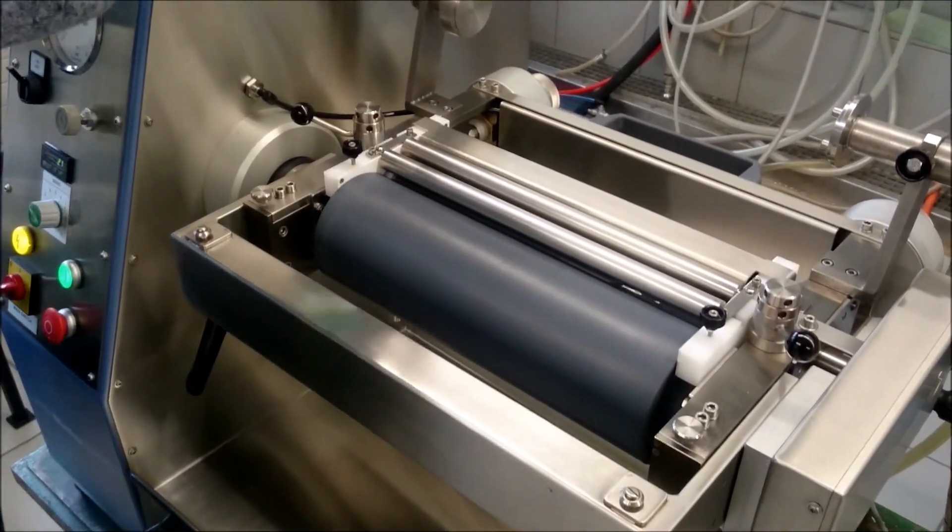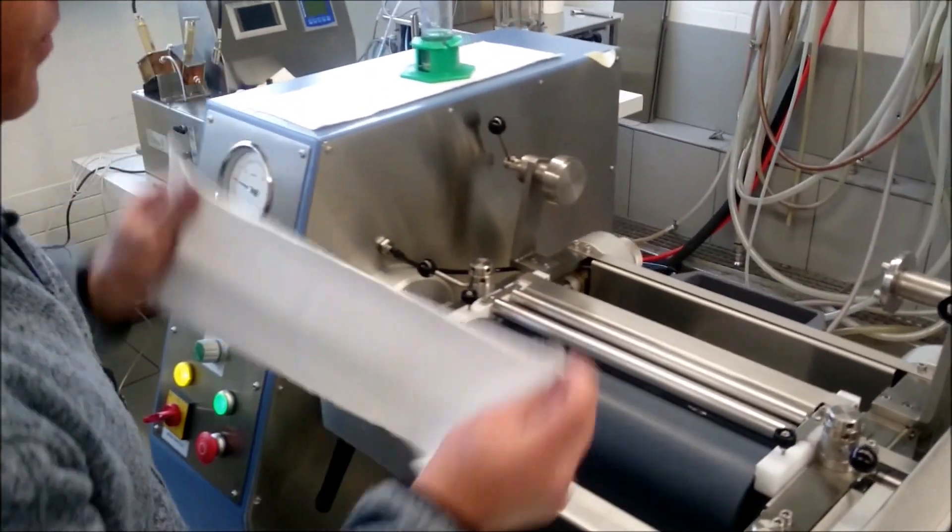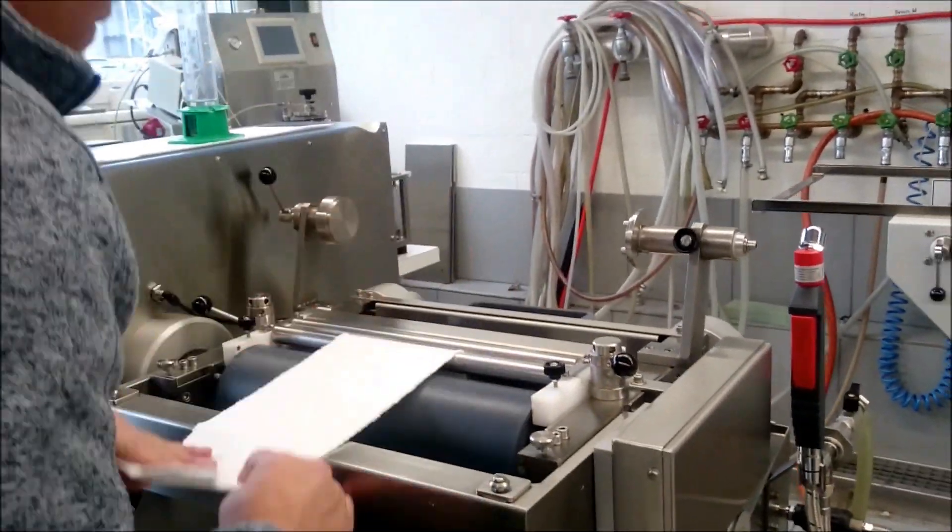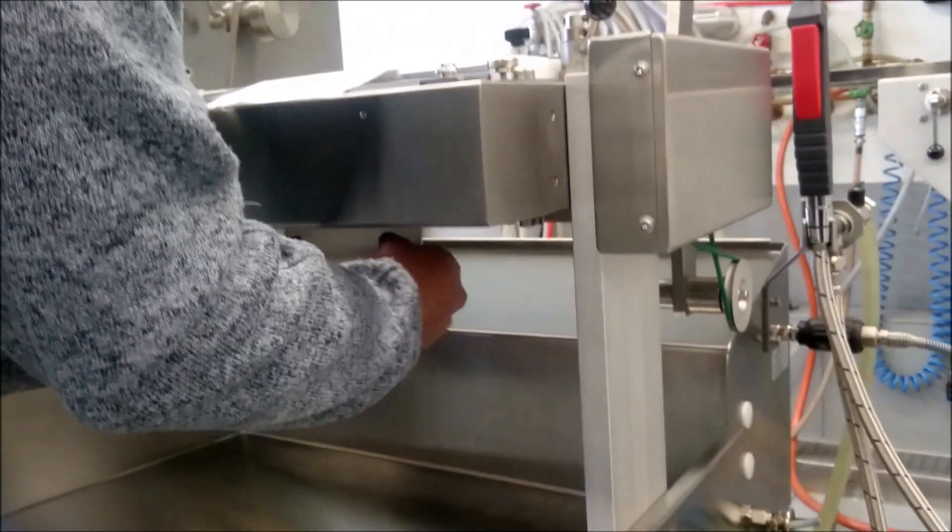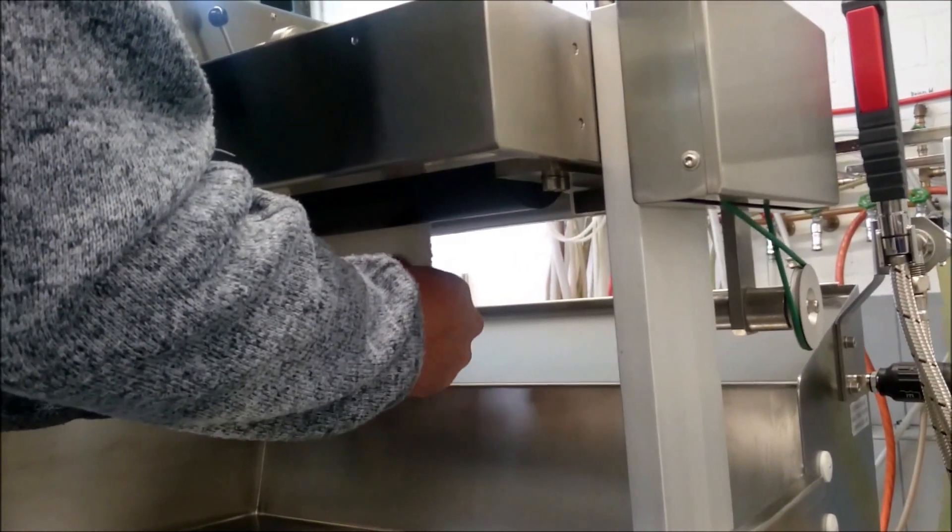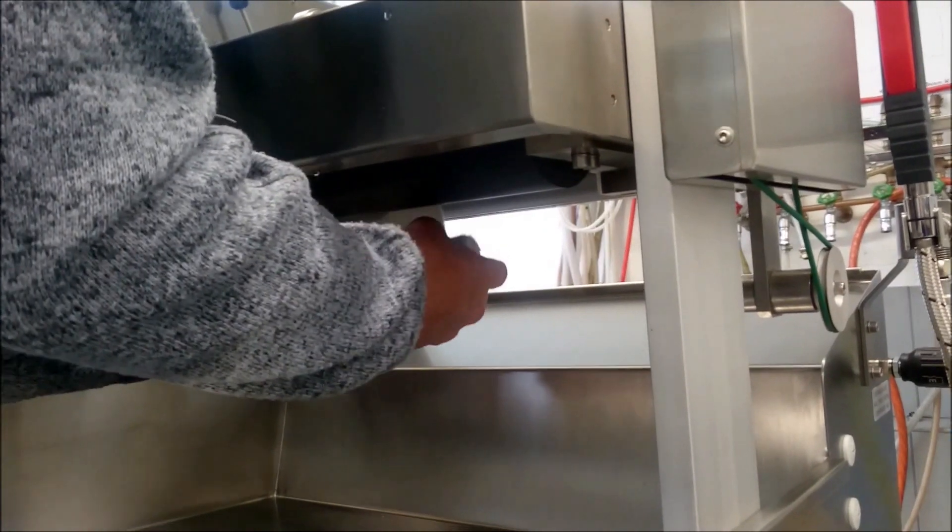With small samples, like this. It's easy. Just put the sample inside. Take it under the nip. Roll it. Or what else you would like to have.